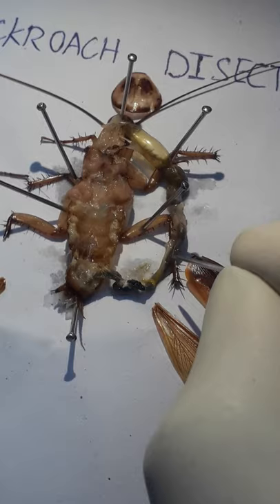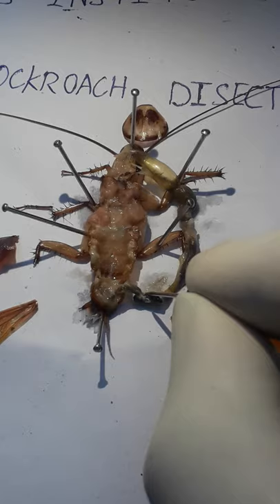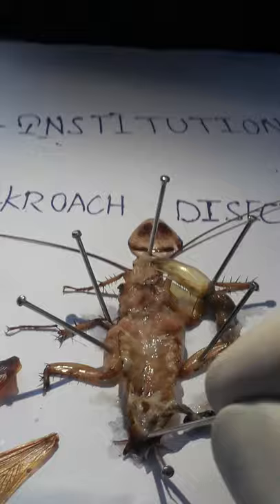Then we discuss the ileum. After digested food material exits, the ileum processes this material and stores some waste material like a storage tank. After that comes the colon, which continues the process.